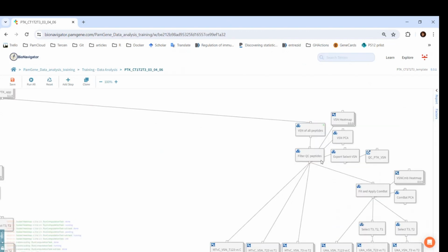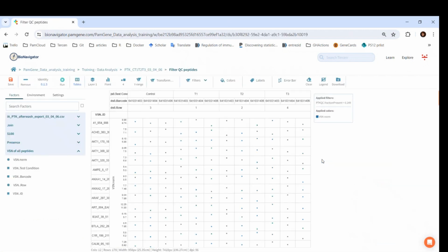The next step is to filter for QC peptides. Here, the filter for the QC threshold is already present. The Y factor is VSN norm, which stands for VSN normalized data. The operator is called identity. It just outputs the same values as in the input. However, when there is a filter in the step, it only returns those values that are in the step. In this case, the VSN normalized values will be only returned for these 178 peptides.